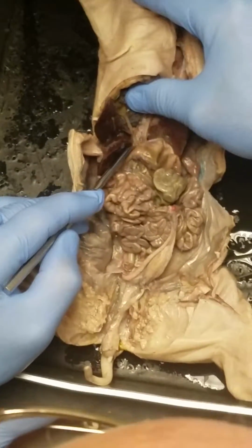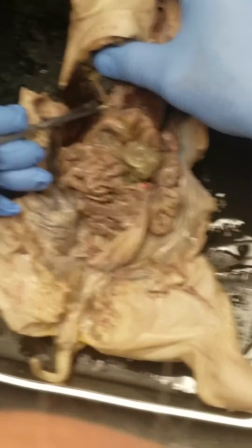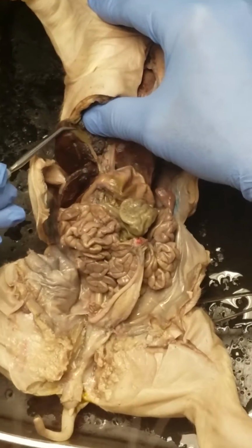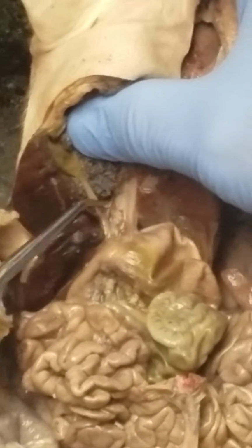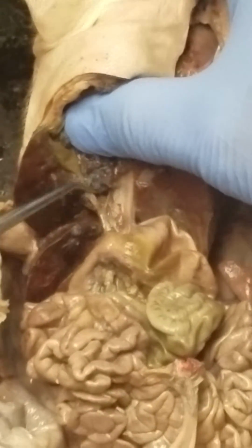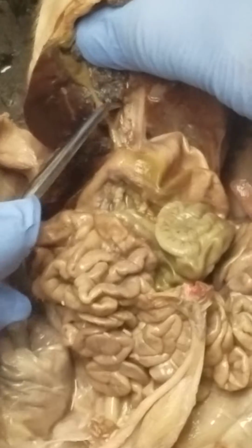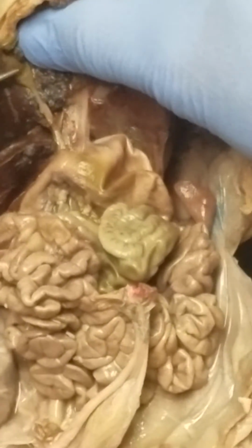So what we're doing is we'll start here. There's the duodenum, pyloric valve. We're going to look for a little tube. So that's the tube. That's the common bile duct. When it branches, one branch goes this way to the gallbladder, which looks like a little blister. And then the other branch goes this way. This isn't quite as good as that other one. Barely see that. This is hepatic. So again, if you think of a Y, the stem of the Y is common bile. The branch of the Y going in the liver is the hepatic duct. The branch going to the gallbladder is the cystic duct.